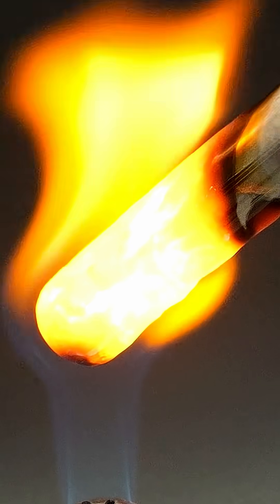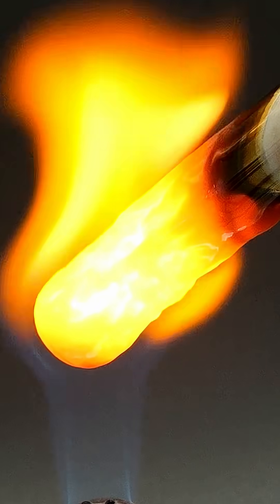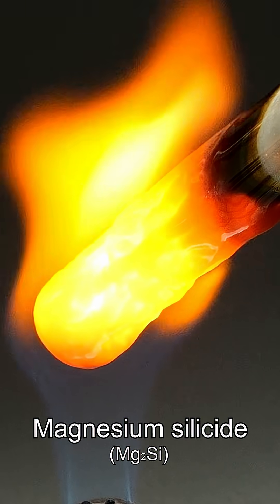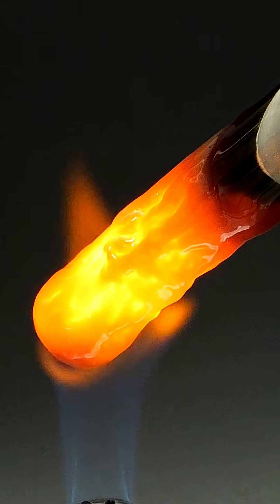This was because this time all of the sand and magnesium was thankfully able to react, leading to the formation of something called magnesium silicide, and the entire thing turned red hot.